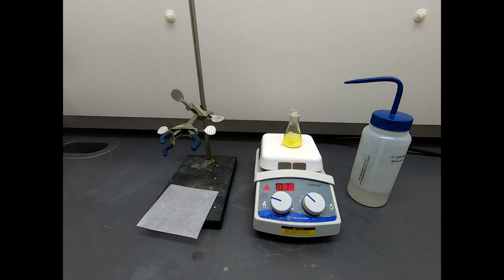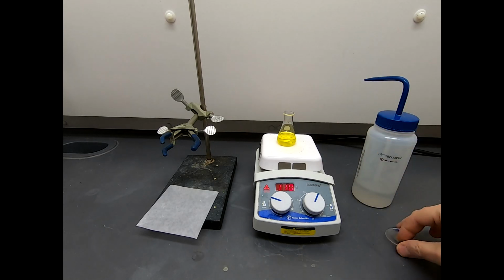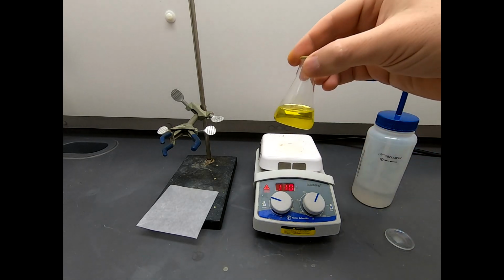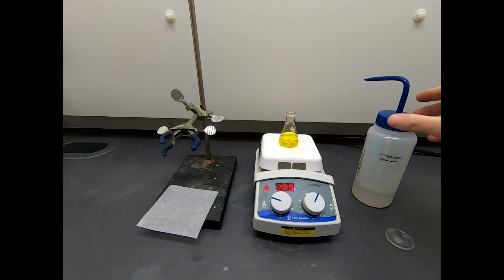So this will probably take a little bit of time to heat up, but it's my impression that this should dissolve in ethanol, and what we're going to do afterwards is we will add water and get this to begin its oiling out. But we have to let this heat up, dissolve first. Okay, this looks really nice. This is all dissolved. This is the product dissolved in 10 milliliters of hot ethanol.